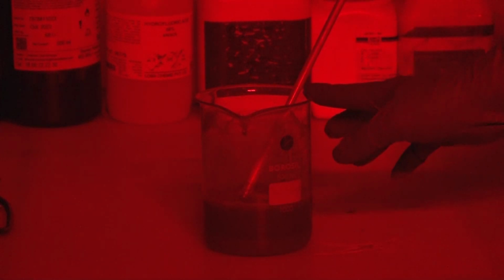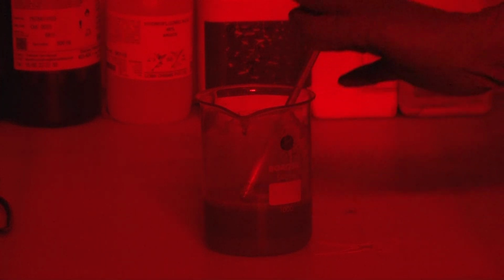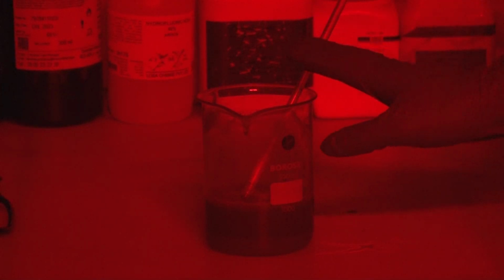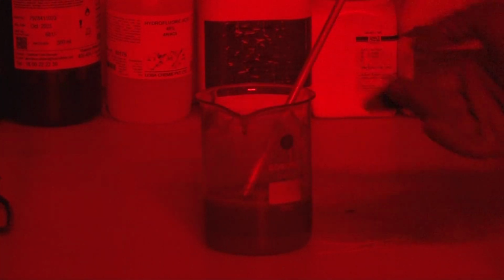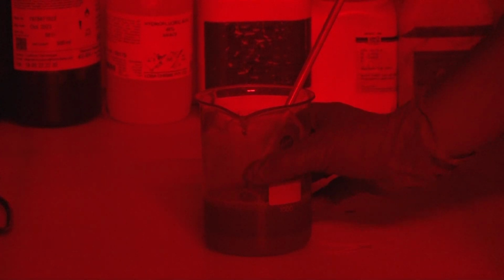To dry, you will use an oven with a constant temperature. Here in our lab we have an oven with a constant temperature of around 45 degrees. At this temperature you have to dry your sample. It will take around 1 week to dry your sample. Then when your sample is dried, you will go for the further procedure of sample preparation.